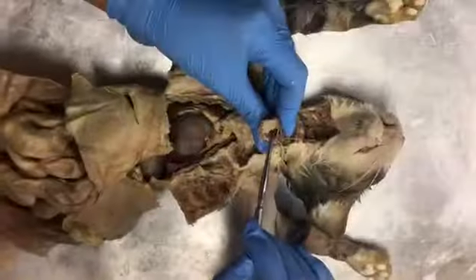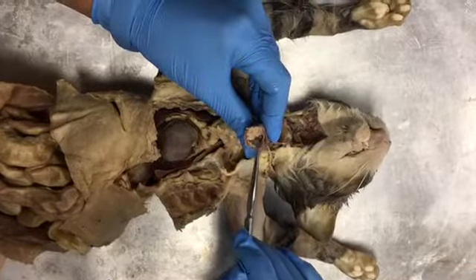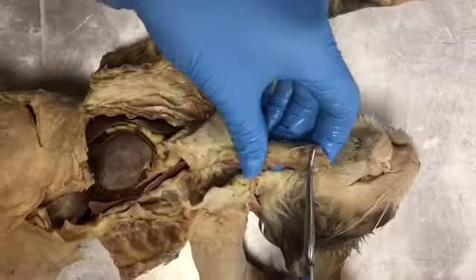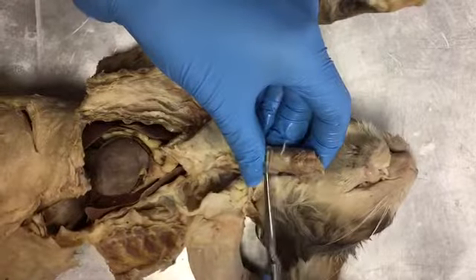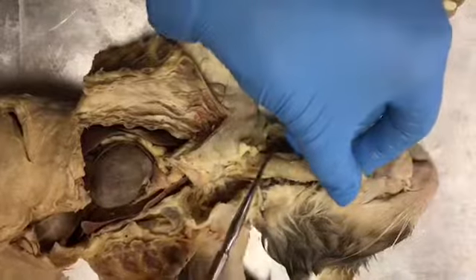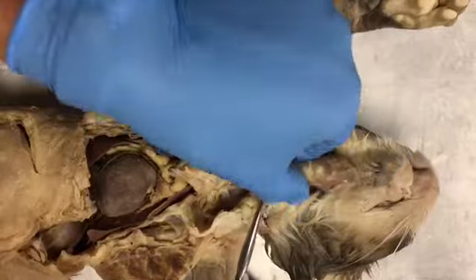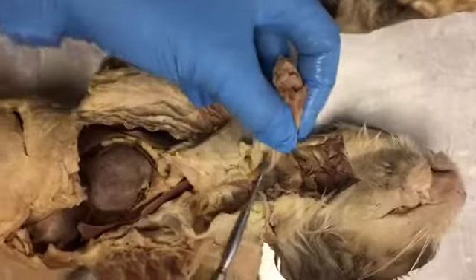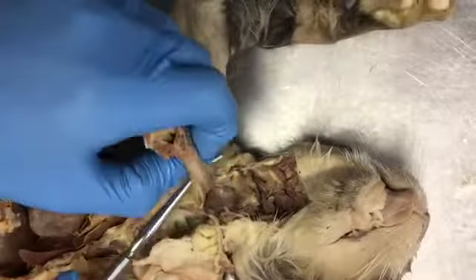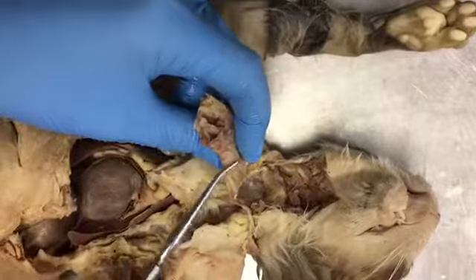Here at the top of the larynx we have the epiglottis, this little hard thing. And then this right here is the larynx, and just below that is the trachea. And on the front side we have the C-shaped cartilage of the trachea. And then we have the trachealis muscle on the posterior side. And this tube running posterior to the trachea is the esophagus.